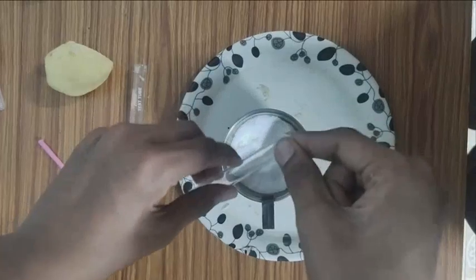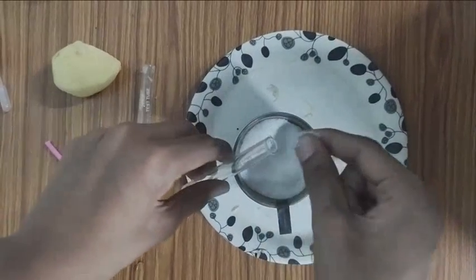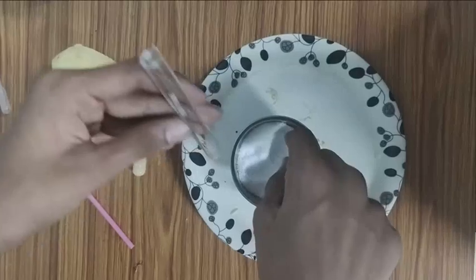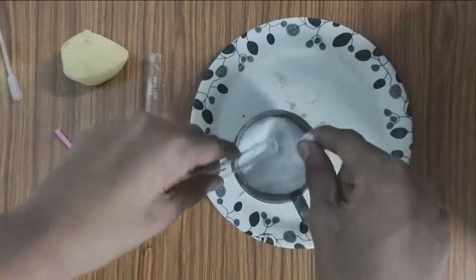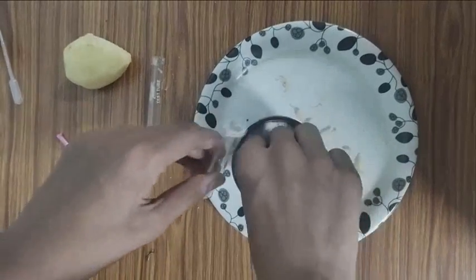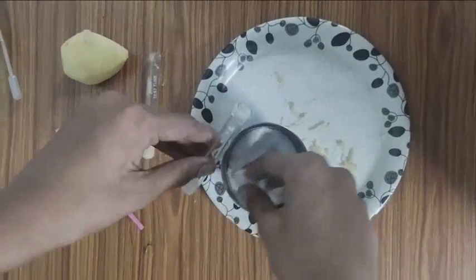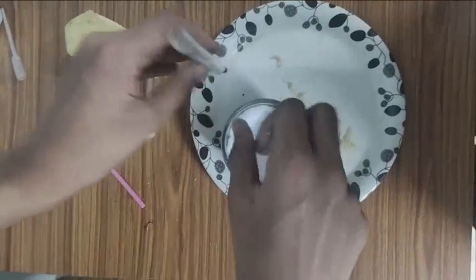Now, take another test tube which is test tube two and start filling it with salt. You can take it from your hand or you can use any other instrument to fill salt in it.